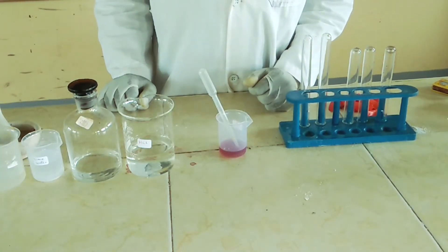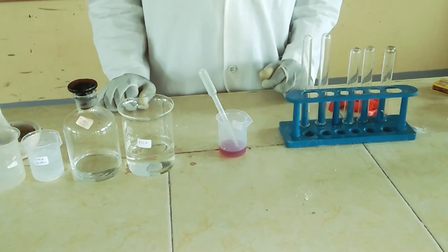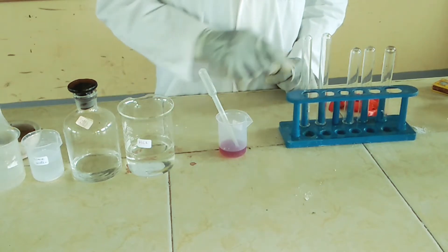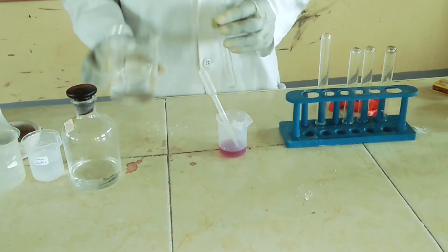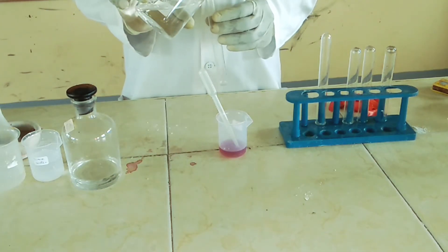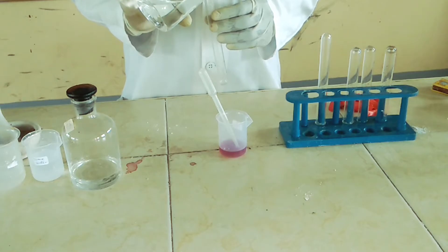Our next part of the experiment is to test if our flower extract indicator really works. So I'm going to test some solutions using the indicator we just created. For example, let me test hydrochloric acid.